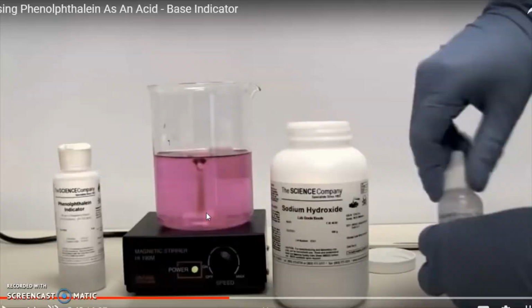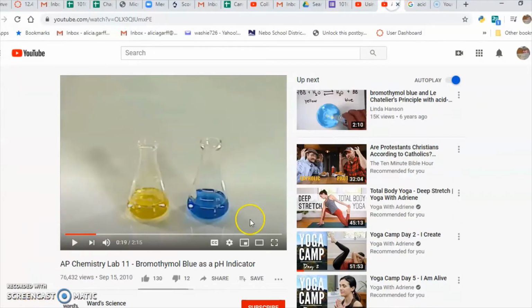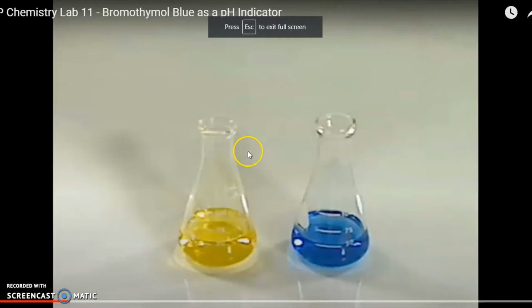Let me show you a different indicator. This shows an indicator called bromothymol blue, and the flask on the left that's yellow, that flask is acidic, and bromothymol blue is yellow when it's in an acid, and the flask on the right is basic. So bromothymol blue, when it's in a basic solution, turns blue. All right, and there's a bunch of different indicators.